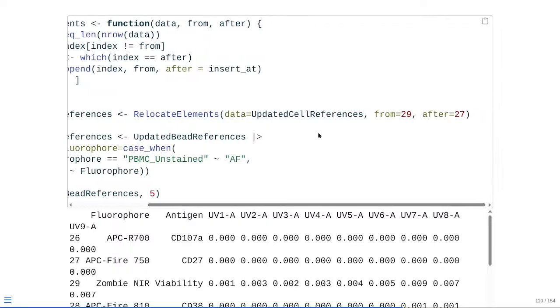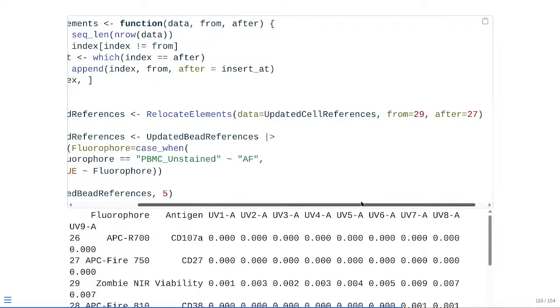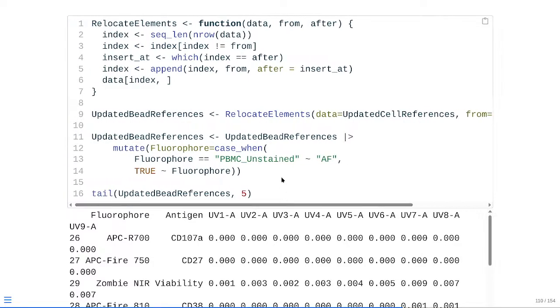But in practice, basically, it takes your data frame, it takes whatever's located at row 29, and then it will relocate it after whichever row you're designating. So in that case, it will move Zombie NIR to the correct location. At that point, we're passing it into dplyr's combination of mutate and case_when, so that when the first column defines a row that is called PBMC unstained, it's just going to rename that one as autofluorescence, and then keep any other values that don't match PBMC unstained as they currently exist, which is what the TRUE tilde sign fluorophore is doing here.